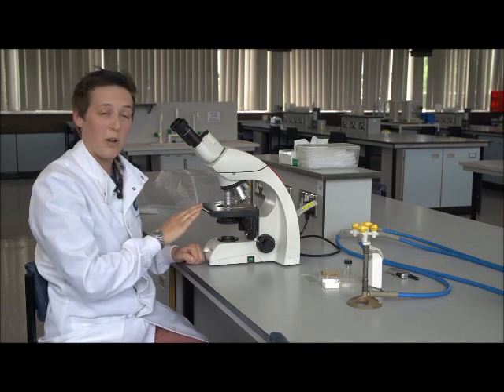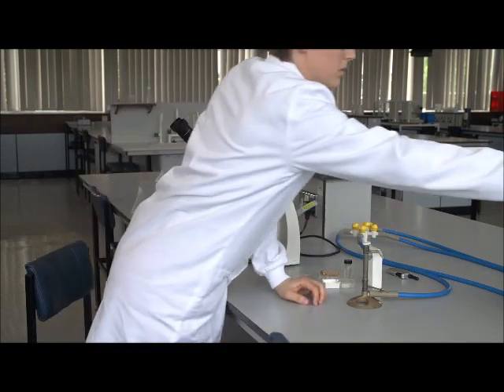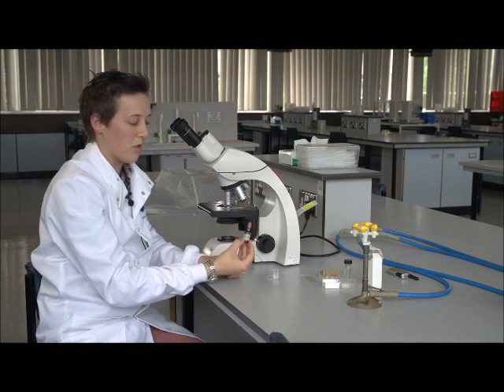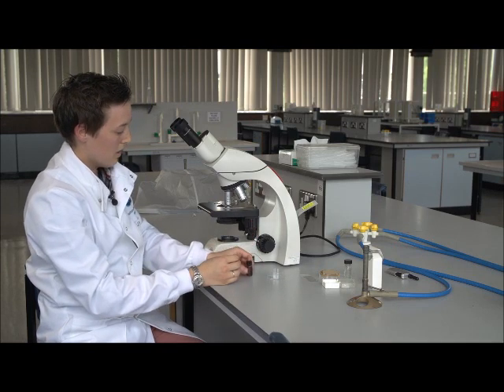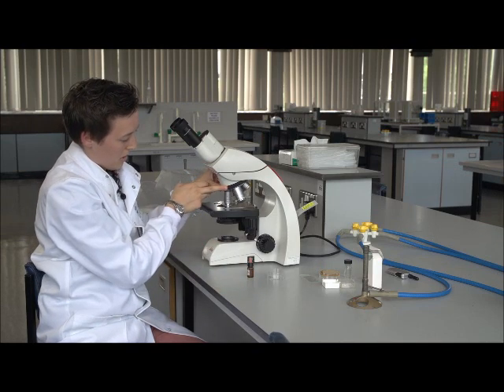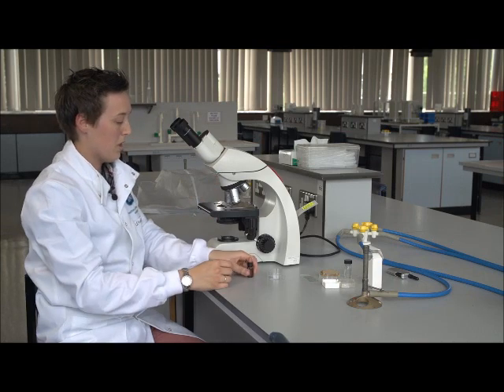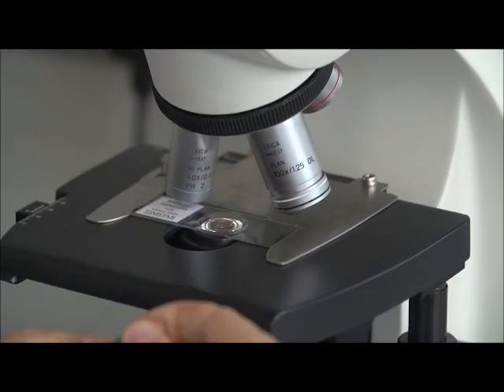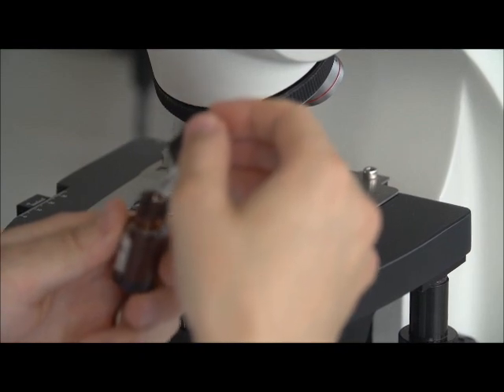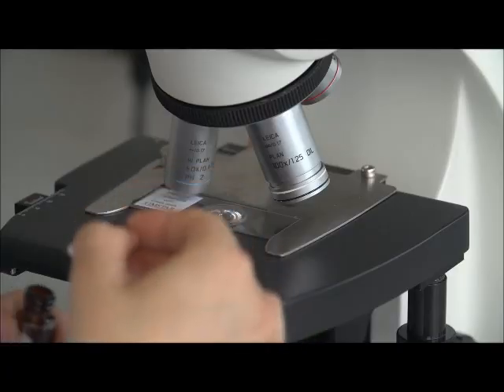Now, I'm happy with the focus that I have at this stage. If I now want to use oil, we use these small bottles that are labelled immersion oil. Now, to do this, a very good technique is to turn the nose piece so that we're at the halfway position between 40 and 100. We then put a very small amount onto our specimen using the dropper. So where you can see the light coming through, a drop of oil.